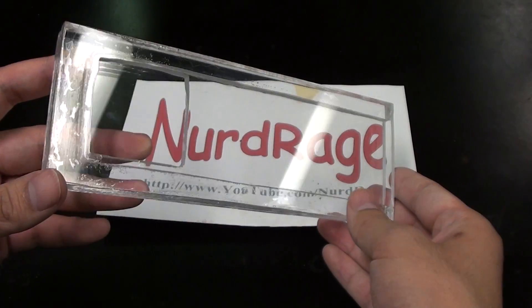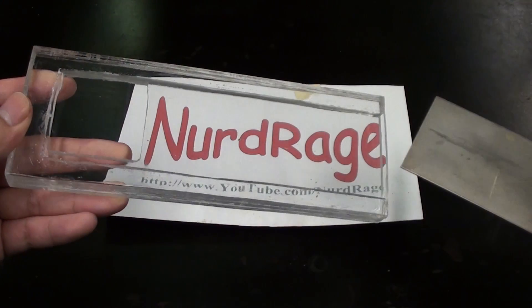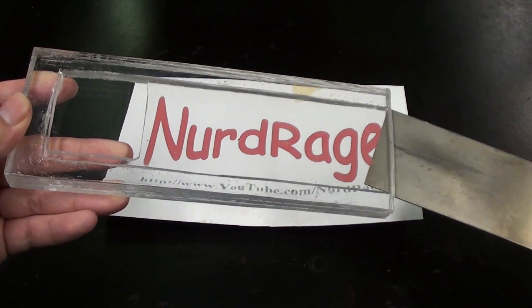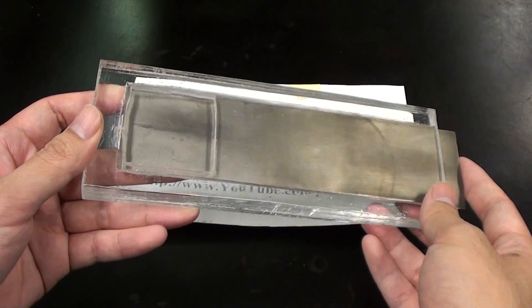And here we are, it's still quite crude with all the little bubbles and imperfections, but this is good enough for our purposes. I'm not exactly trying to make art here.